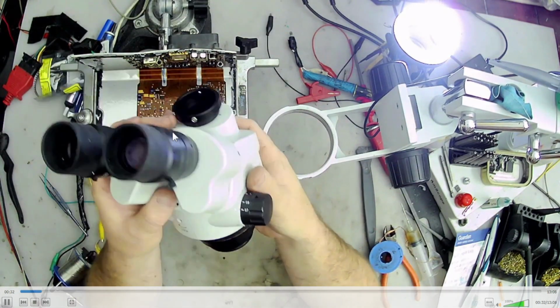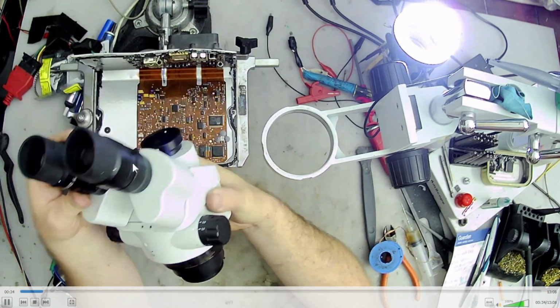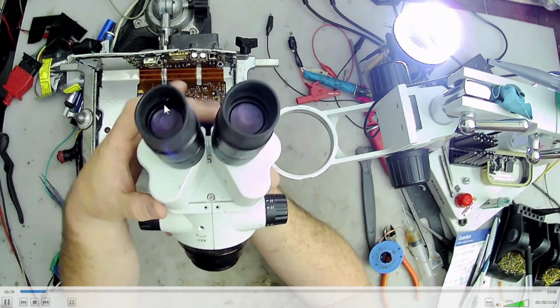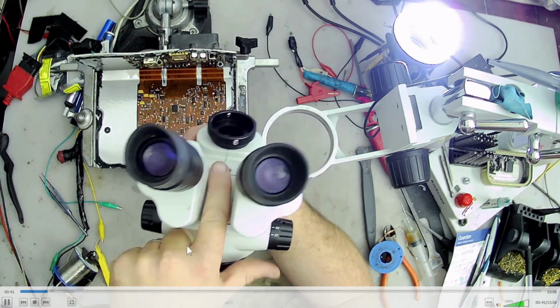You can take the eyepieces out too. I think I ended up leaving them. Yeah, but you see they unscrew. You can take the whole thing off, but I ended up leaving them because I didn't want a lot of dust to get up in there.